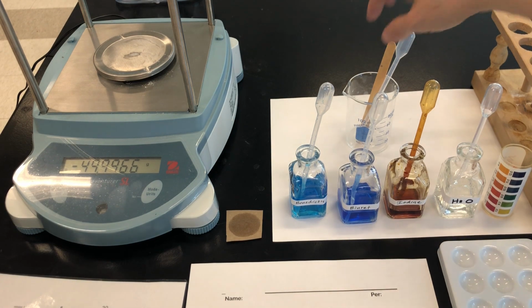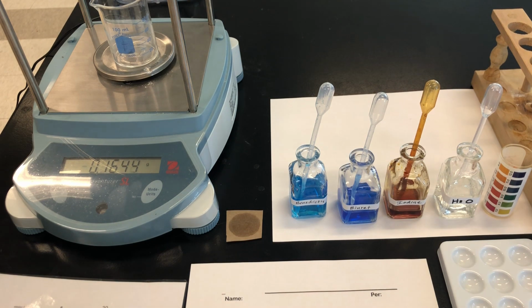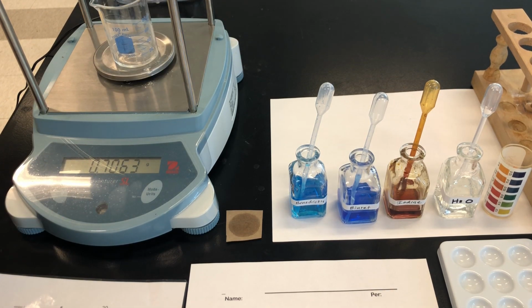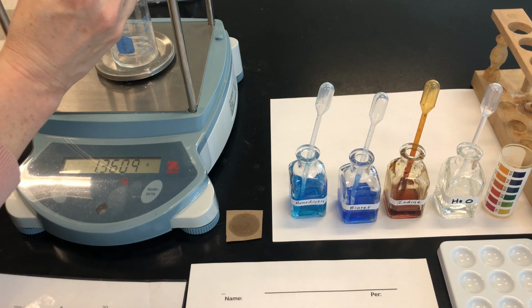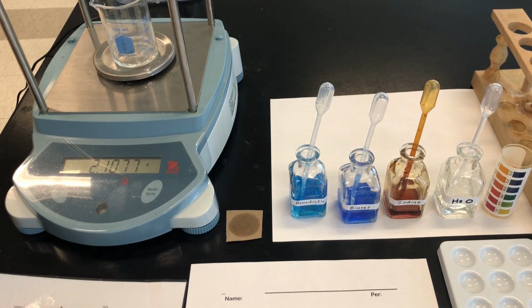So to begin, I'm going to take the empty beaker and place it on the scale. I'm going to zero the scale. Then I'm going to add 2 grams of my food substance. In this case, this substance is a liquid. So I'm just going to add until I see 2 grams on the scale. We zero the scale to make sure that the scale is ignoring the beaker and only measuring the substance that we're adding. As long as it's close to 2 grams, that would be fine. I just want to make sure you have enough and that we're not wasting materials.